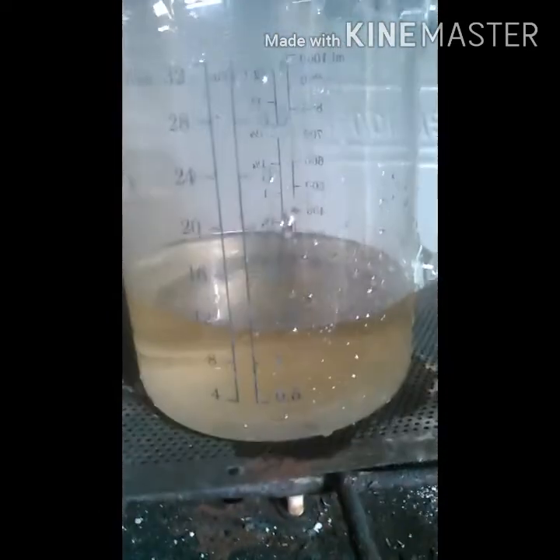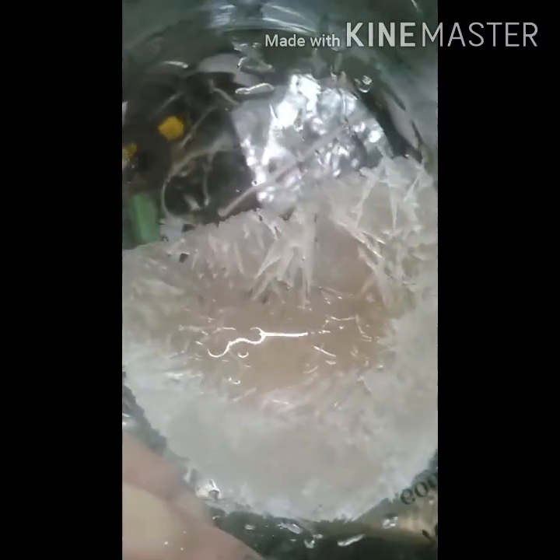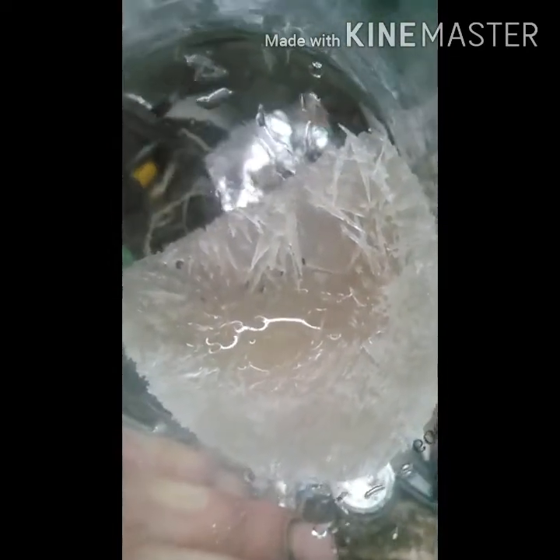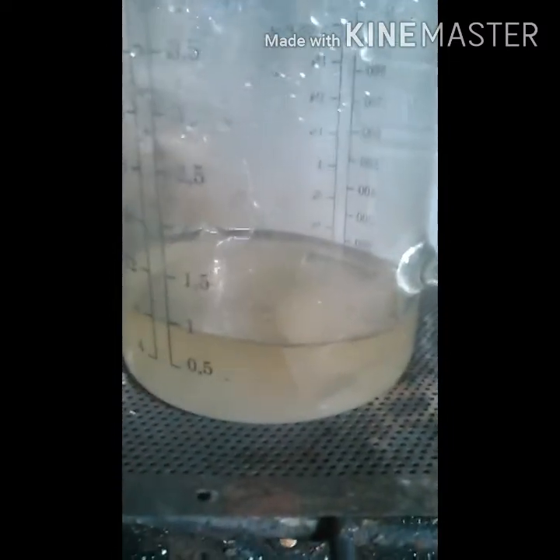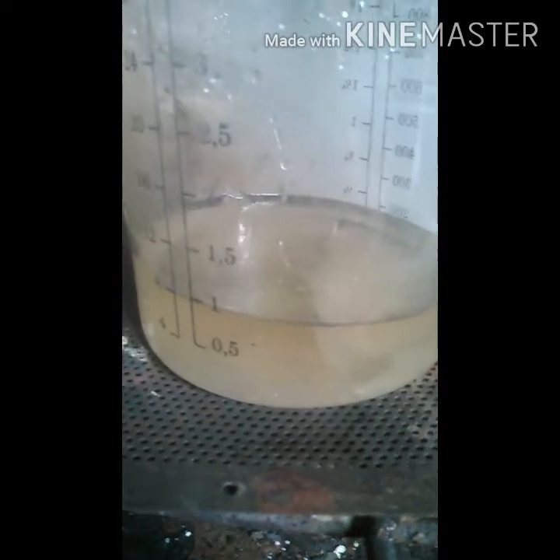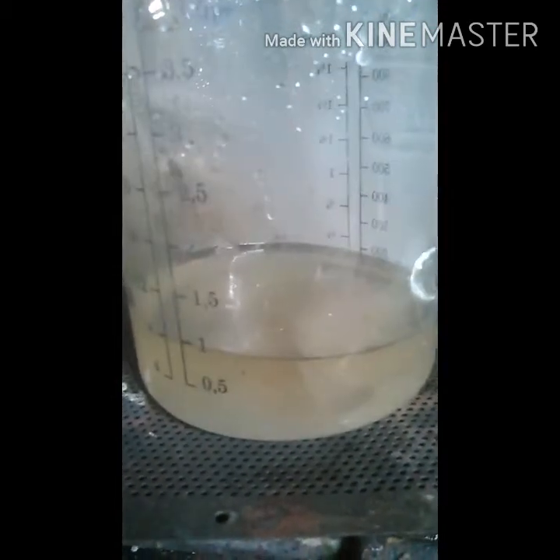As you can see, it's gotten a lot more clear, so I'm starting to get close. I'm re-dissolving it again — this is my third time. I just wanted to show the clarity I'm finally getting to and the needle crystals. My phone doesn't do much justice to what they look like, but they're really neat looking. Another thing I wanted to point out is that the reaction when I take the crystals and combine them with water is endothermic — it's not crazy cooling, but the cooling is obvious; you can definitely tell.